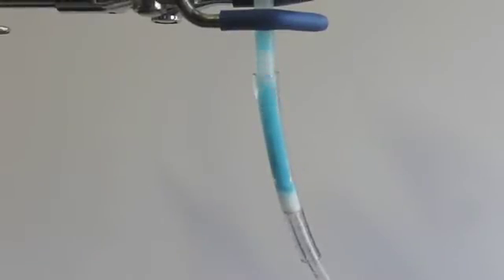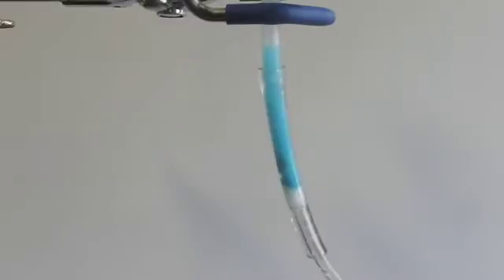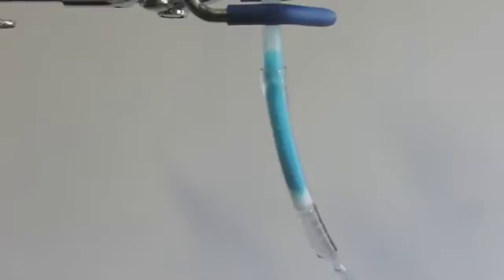Now simply pull on the syringe several times to suck the water out of the solids. The cotton is acting as filter paper, and is allowing the water to pass through, but not the solid product. Drying our sample in a narrow tube like this is much more efficient than drying it on a piece of filter paper, because less of the product is contacting the wet paper, or in this case, the cotton.